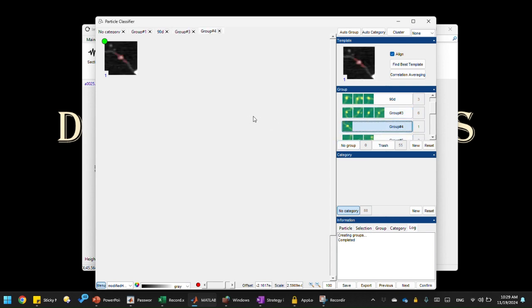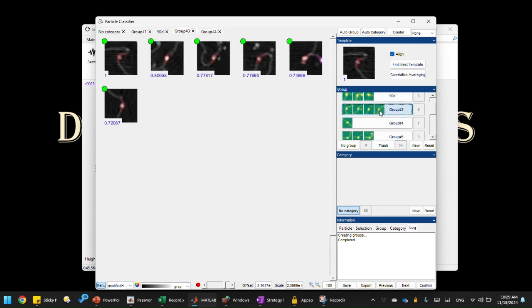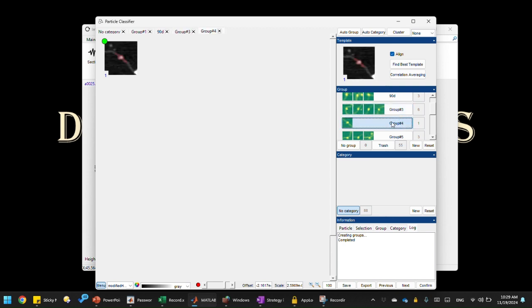Let's turn to the next group. Oh, this is the unbent state. And these groups are sorted by their correlation. For example, this unbent state, group 4, is similar to group 3, right, in some way. So if you sort group 4 by its correlation, like you see, sort by correlation to this group, group 3 comes not on top, but it's close enough.